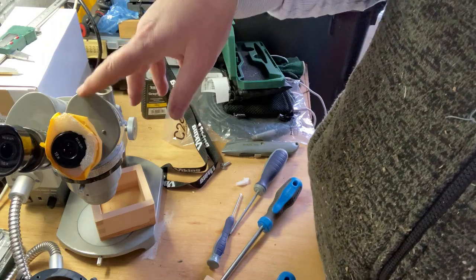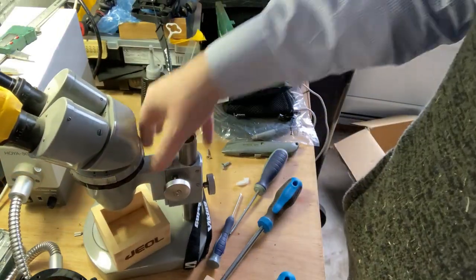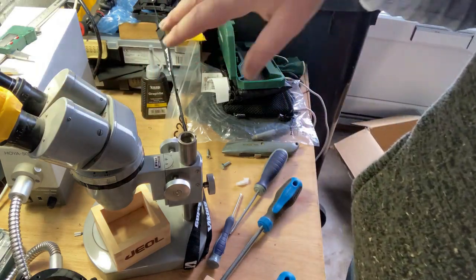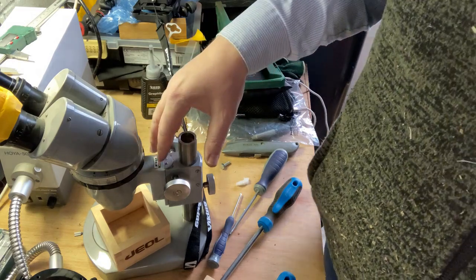As I say, maybe I will take this apart in a future video. It's all just screws together, but I don't actually want to. The danger of me doing that is everything might just fall off and I can't reattach, so I need to have a lot of think about it. So next step I will be ordering the X displacement, and that is a further look into the breakdown of the X drive mechanism and where the problems are that I have to replace. Rather than trying to repair it, I'm going to just buy the displacement motor itself, or not motor, drive.